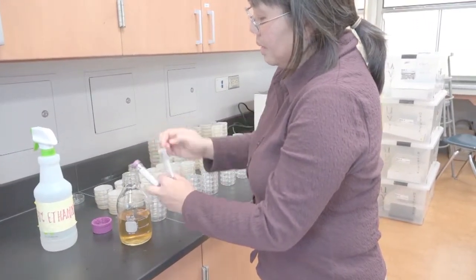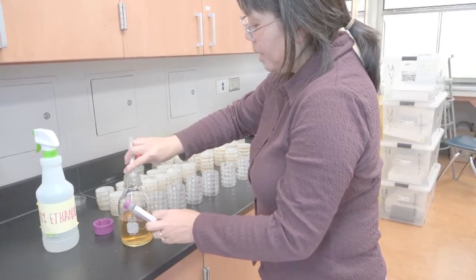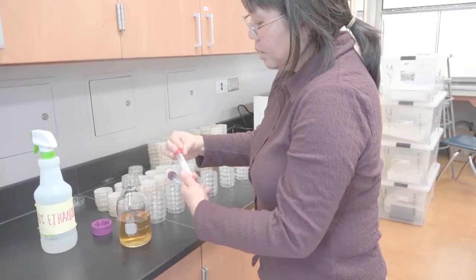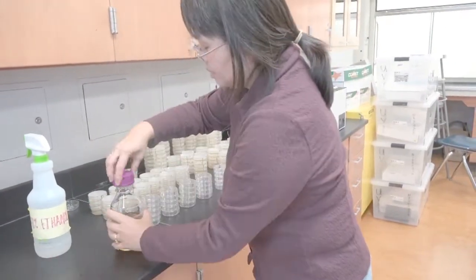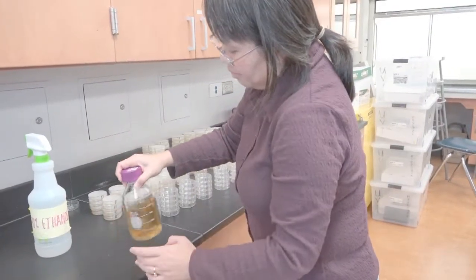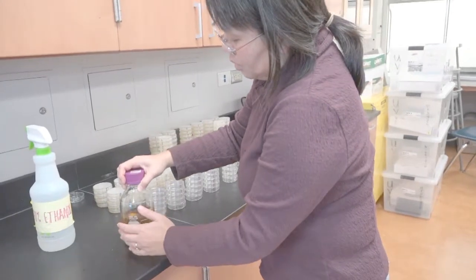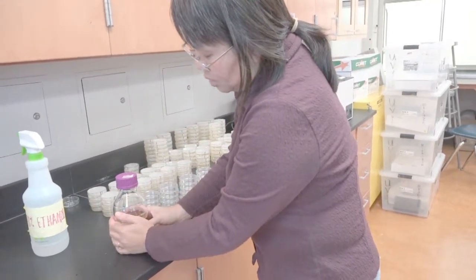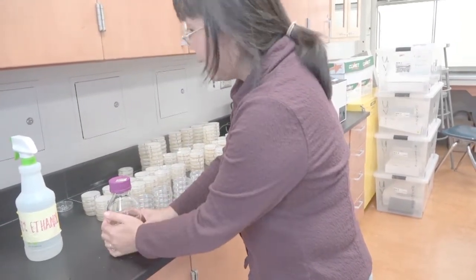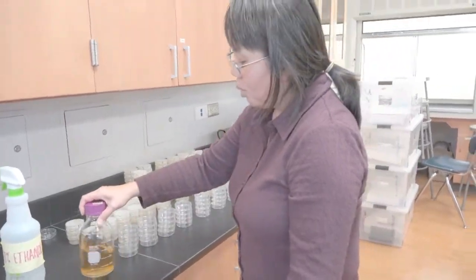There's something very important that I forgot to mention: your LB agar should be cooled to about 55 to 65 degrees. So it's relatively cool to the touch. I'm not being burned by it. So now this is ready to pour.